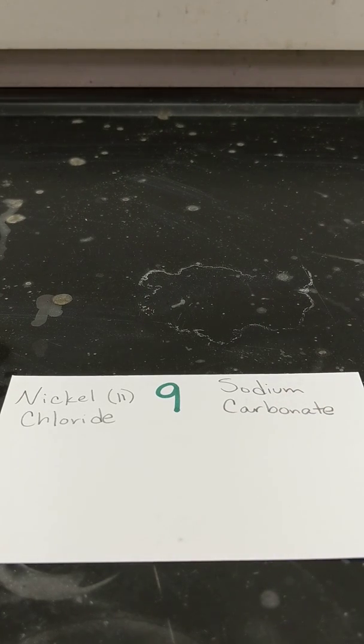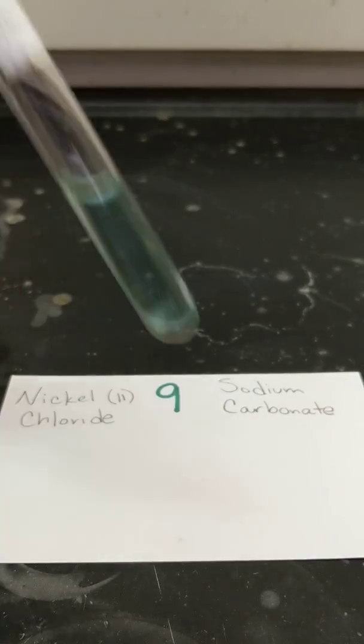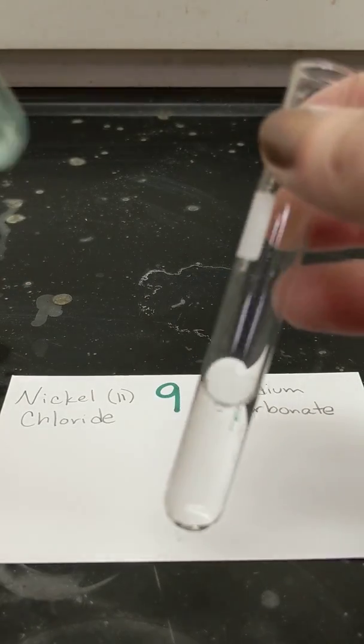Reaction 9, nickel chloride and sodium carbonate.